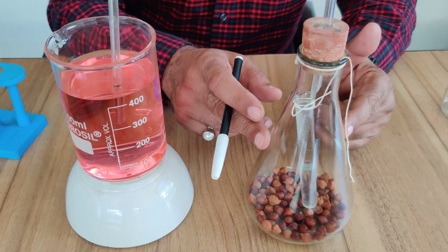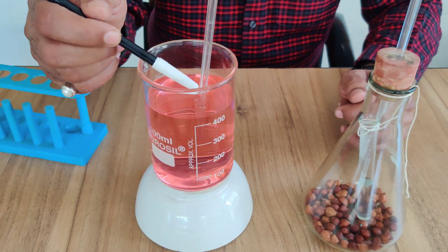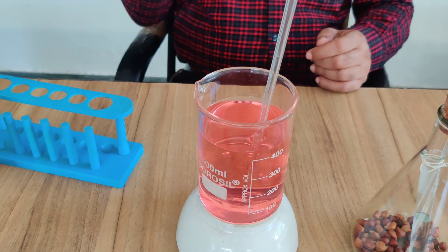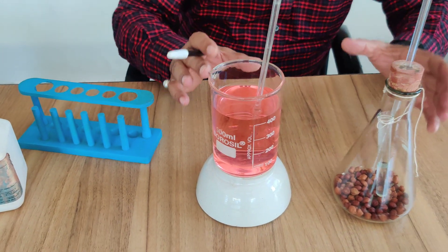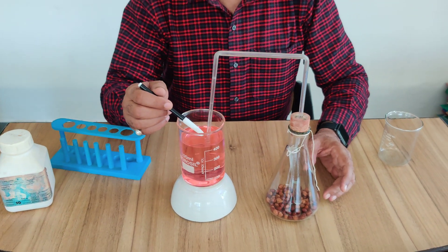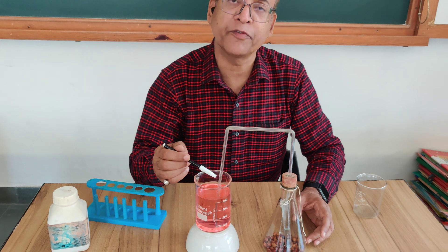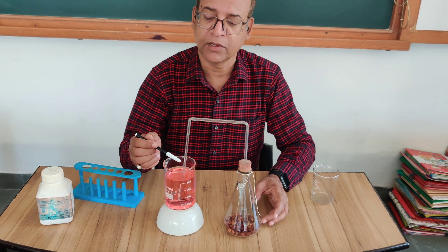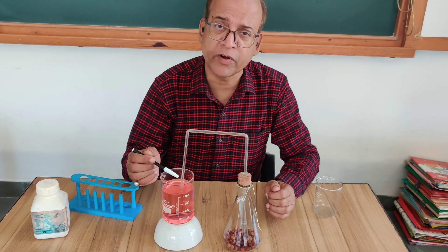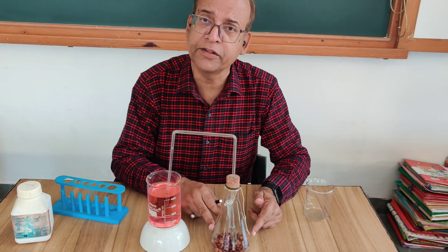So you can understand that a type of vacuum is created in the conical flask, because the seeds are taking oxygen and the CO2 given out is absorbed by the KOH solution. To compensate that decrease in pressure, water starts rising up in the delivery tube. When we observe this experiment after 2 or 3 hours, you will find that the level of the red colored water rises up — and that rise in level indicates the rate of respiration of these germinating seeds.